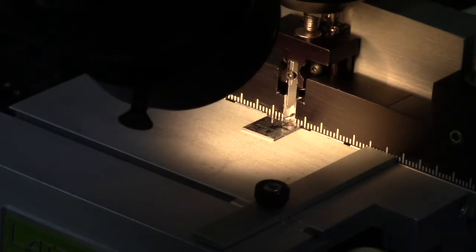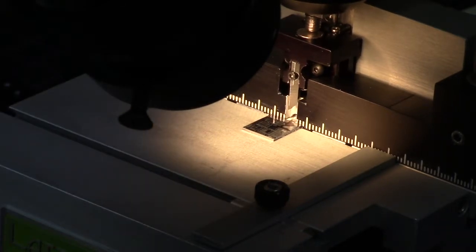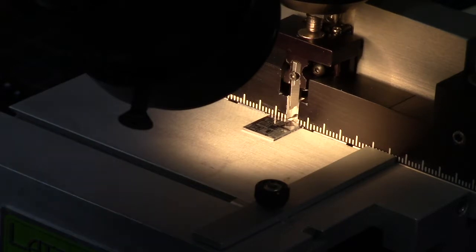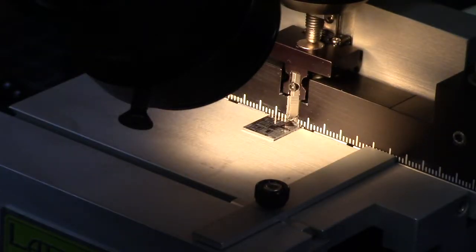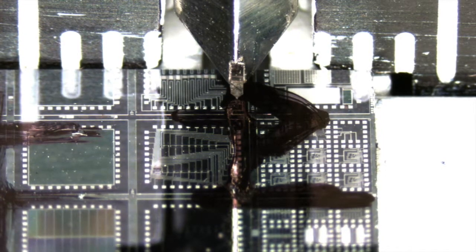So now I'll position the indenter for my first cut to create the three millimeter sample. You see the indenter and you see my line and the arrow. So now indent is normal.